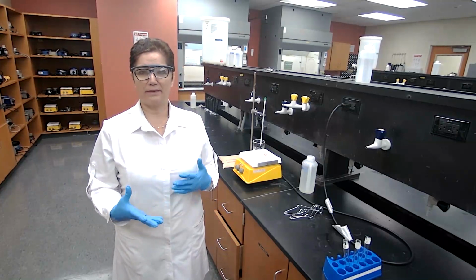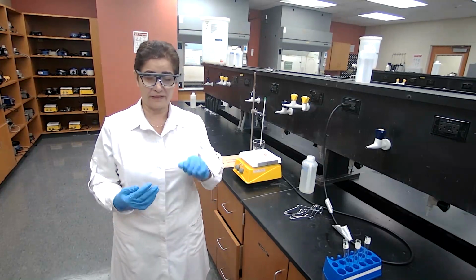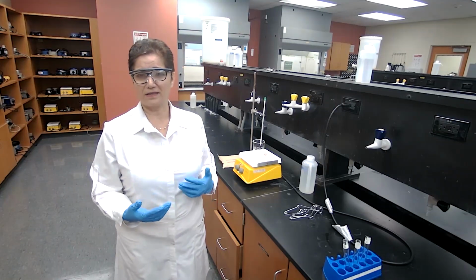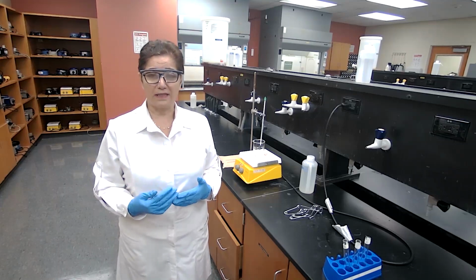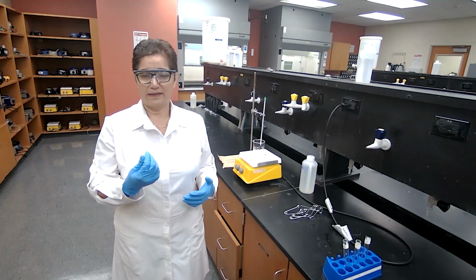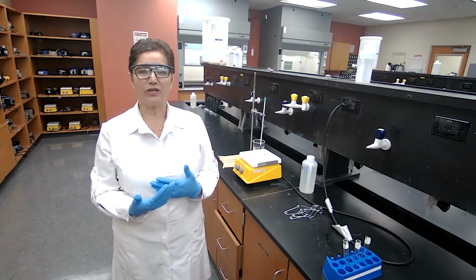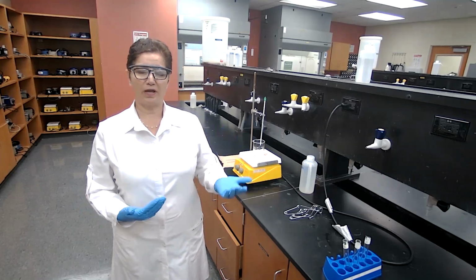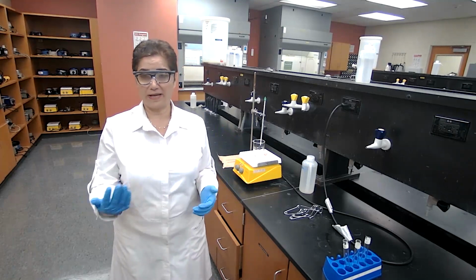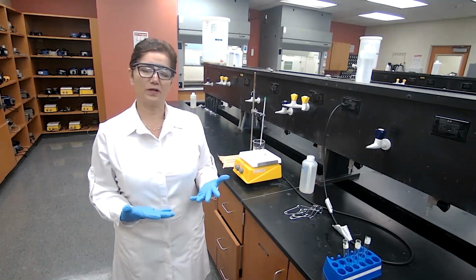But since I'm recording and I don't have other groups, and I am your lab partner, I'm going to prepare all 3 esters of A, B, and C. Based on the smell or odor, we are going to identify which combination gives what type of ester and connect it to the odor. This is the known part of the experiment, or part 1.